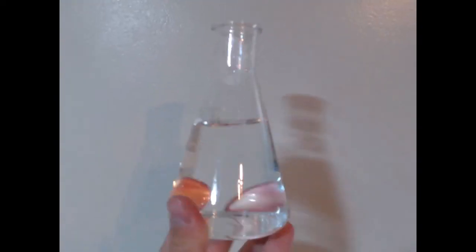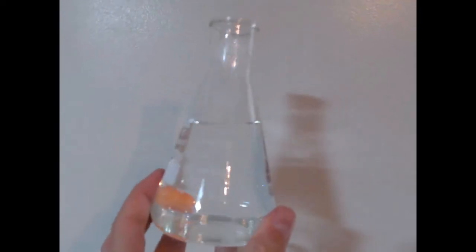After about three hours, we were able to recover about 250 milliliters of pure distilled water.